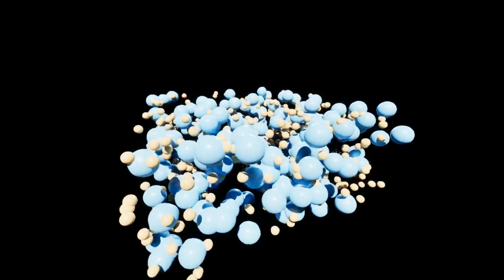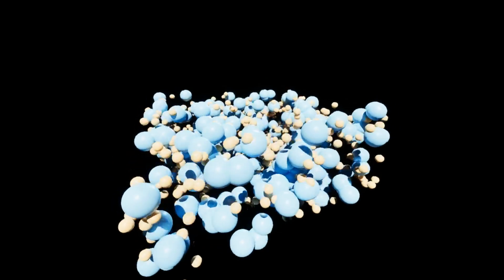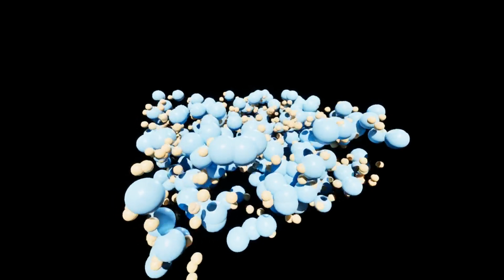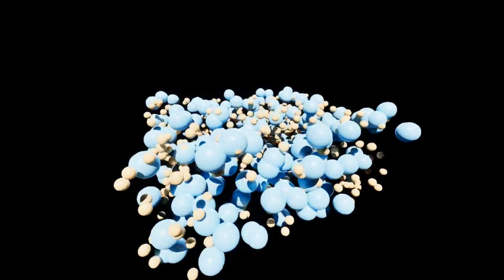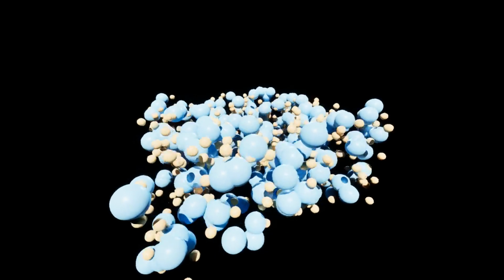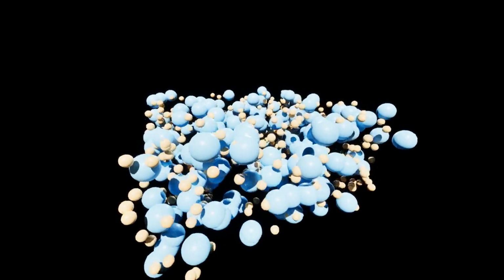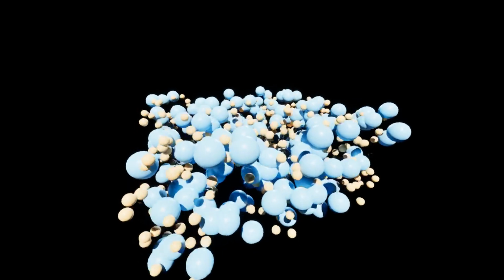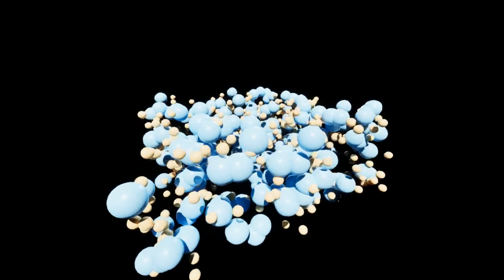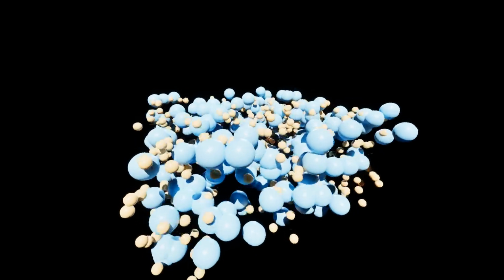You can animate. The plugin plays DCD trajectory files with interpolation between frames. Both byte orders are handled, and files with fixed atoms are rejected rather than silently misread. And you can hand the structure to Niagara. Atom positions, radii, and colors are pushed into Niagara array parameters, so any particle system can read the molecule without custom shader work. Color by element in the usual CPK convention, by chain, by secondary structure, by B-factor, or by the AlphaFold confidence palette.